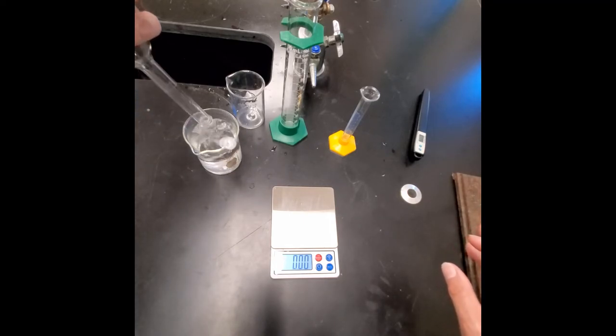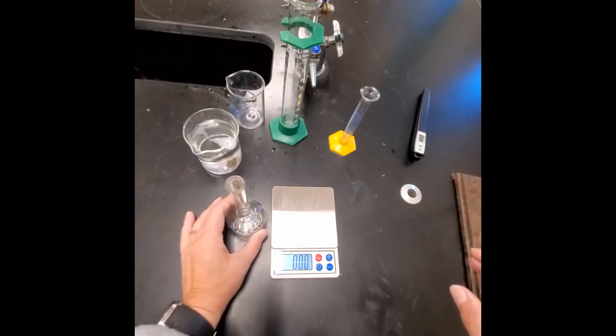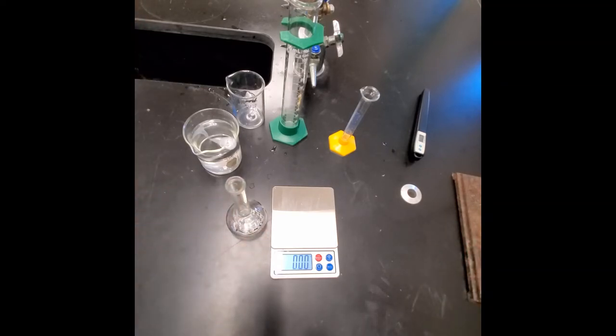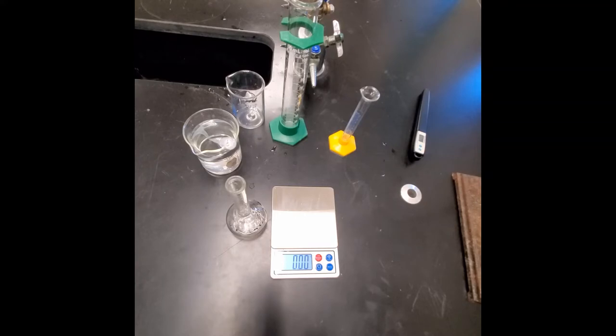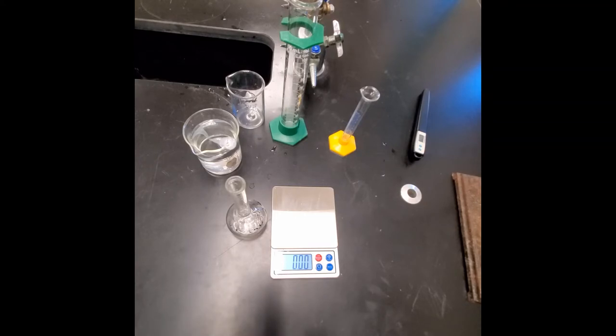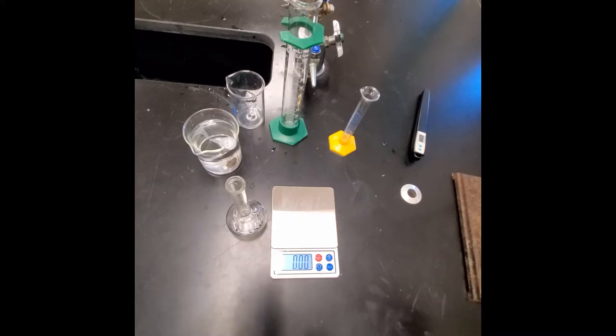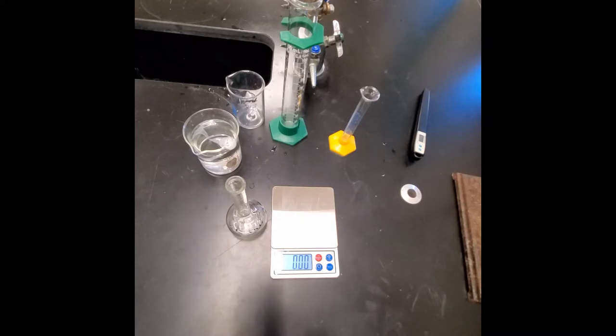The computer spreadsheet is set up to calculate the density for you. We'll calculate the average class density, compare it to the true density value to get the percent error, and use the standard deviation to assess precision.